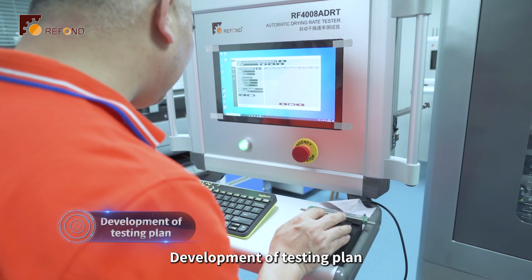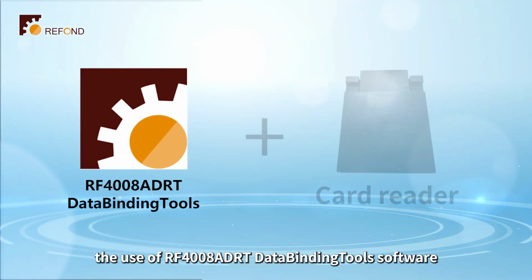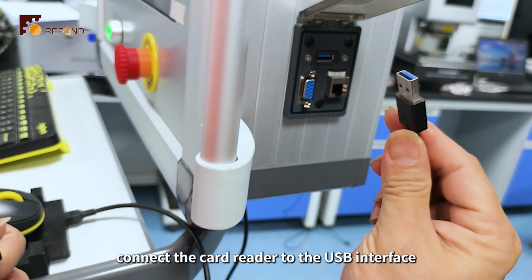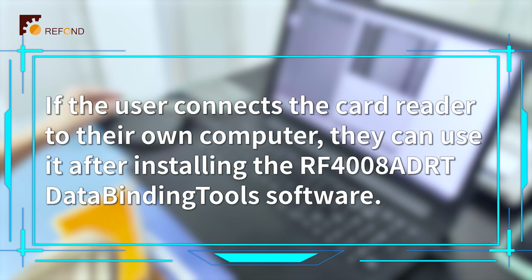Development of testing plan. The development of the testing plan requires the use of RF4008ADRT data binding tools software and a card reader device. Firstly, connect the card reader to the USB interface on the side of the industrial control all-in-one computer through a USB cable. If the user connects the card reader to their own computer, they can use it after installing the RF4008ADRT data binding tools software.